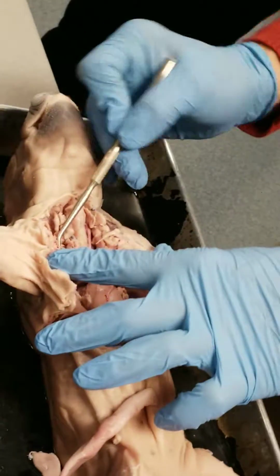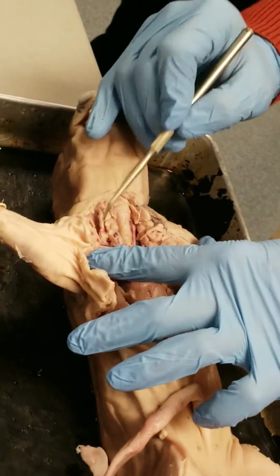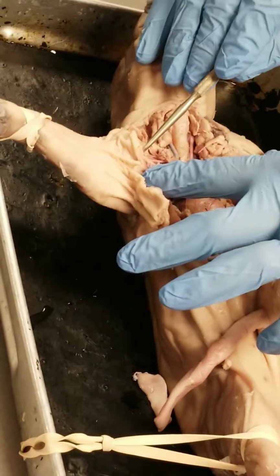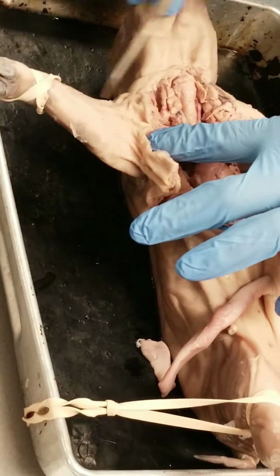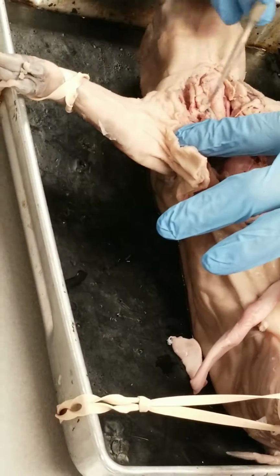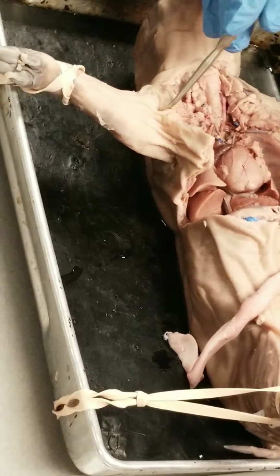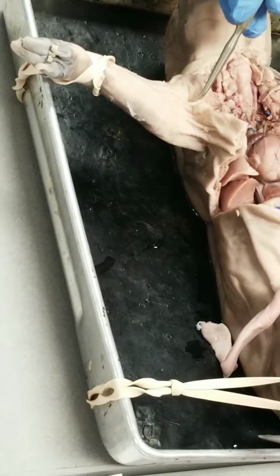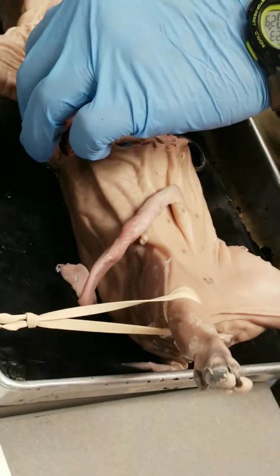As that vessel continues to move, and this is where I'll need to clean it up some more, and I'll do that while you guys are working. But as you continue to move along that forelimb, as you get out a little further along the forelimb, then we identify the vessel as the brachial artery. And we don't go beyond that. That's more than I think most instructors do anyway.